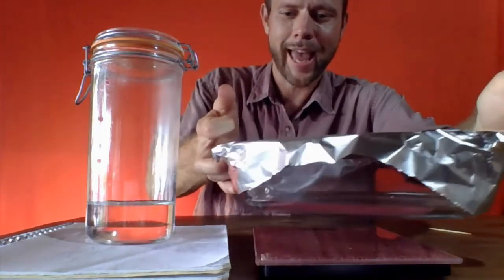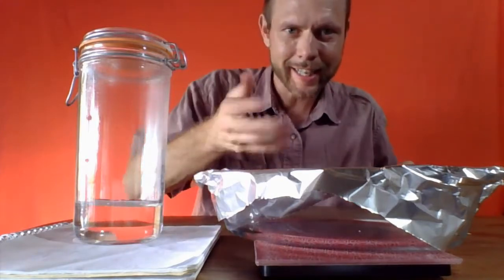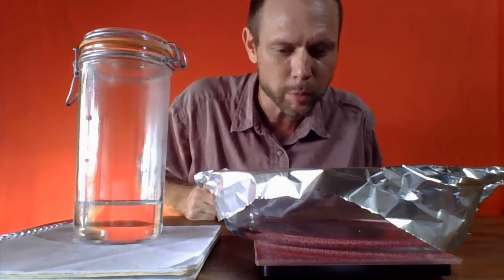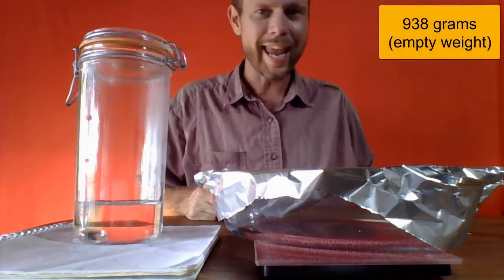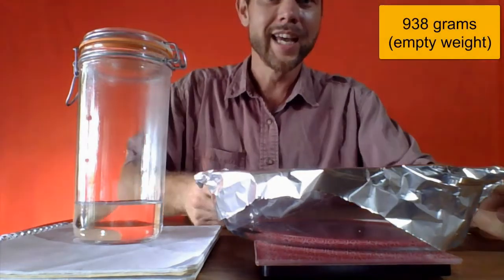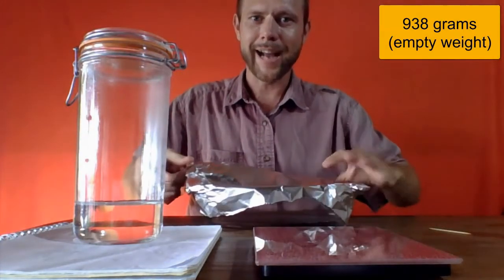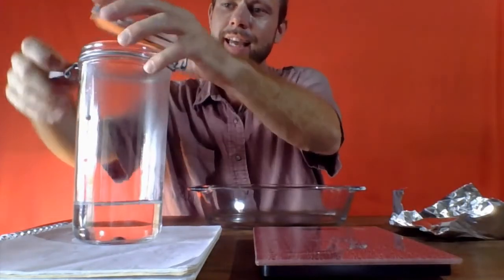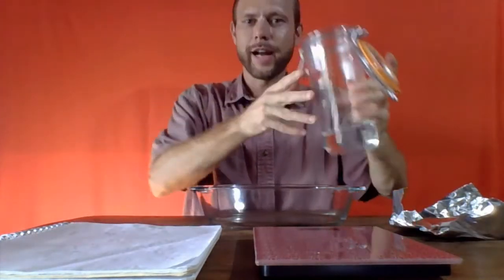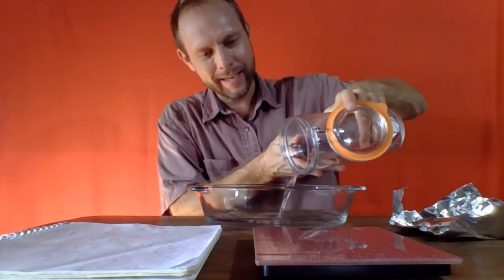So let's take a look at how much this weighs, and it's telling us the dish plus the lid, the aluminum foil, we have 938 grams. So I'm going to note 938 grams. We'll certainly come back to that later. Now I'm going to carefully take the lid off, and now we have our salt water, our filtrate. I'm going to pour it in.